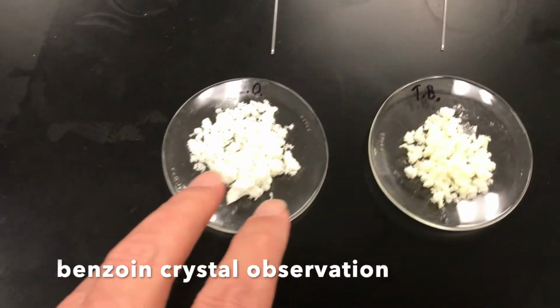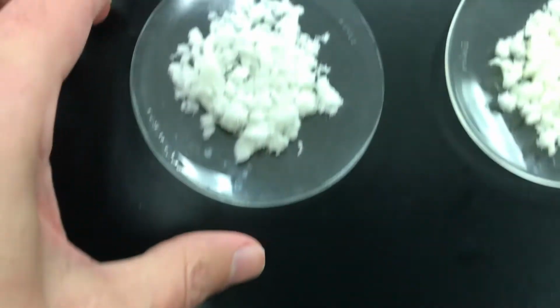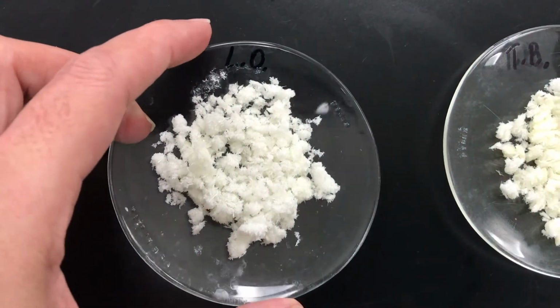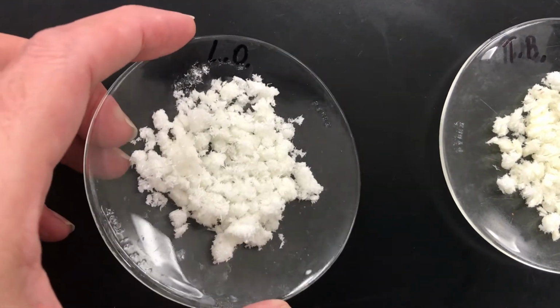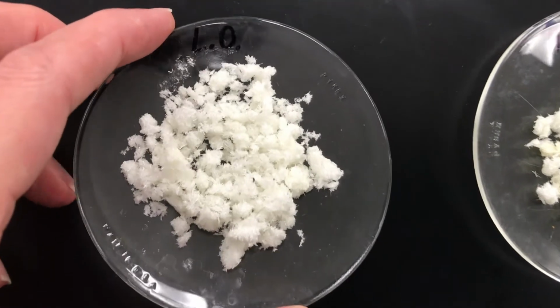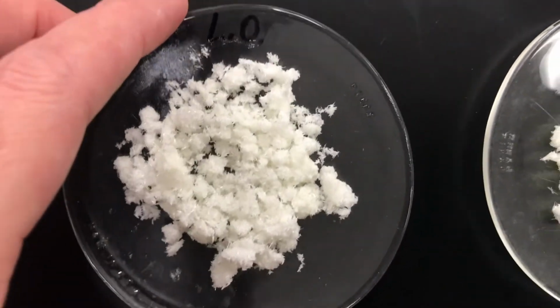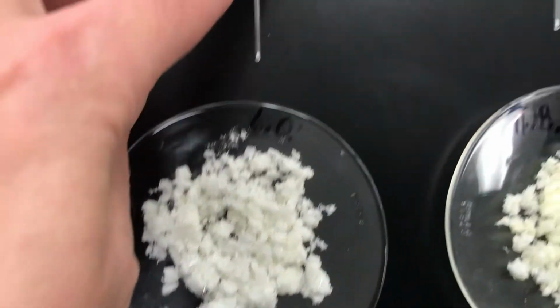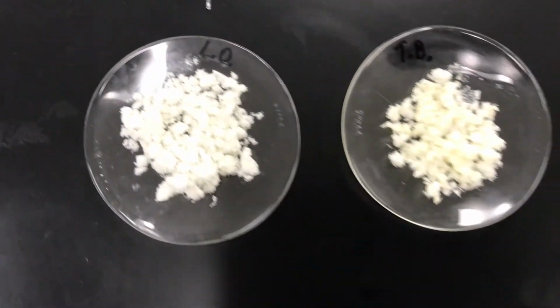Here I want to do an analysis of the benzoin we produced and show you the quality of crystals that we formed. So this is the Lauren Oils reaction to form benzoin, and the product has this appearance here, so you can take a look at that. Spindly, flaky, whatever you want to call that. It's fairly white, and I prepared a melting point tube for that, and it's going to be the left tube in the melting point apparatus.